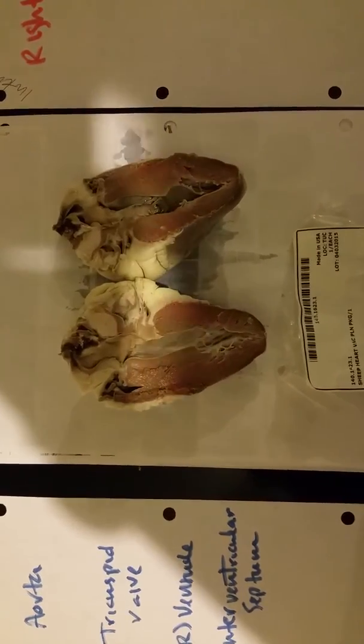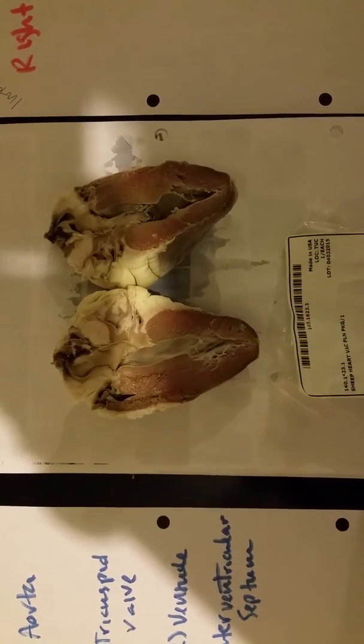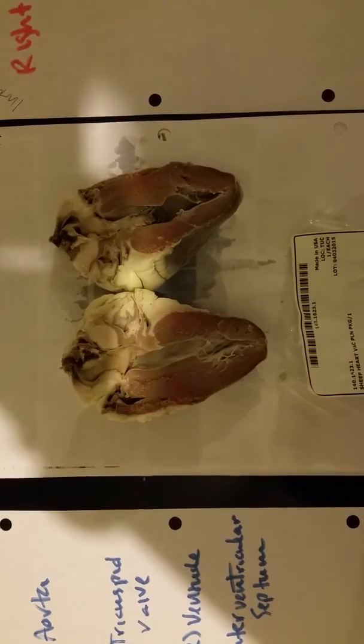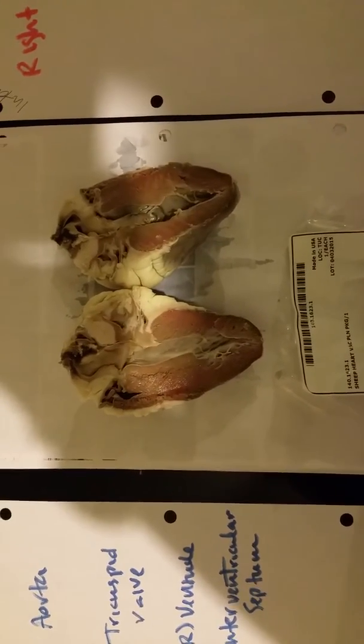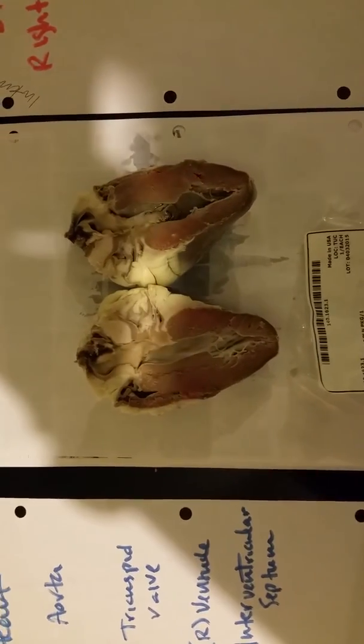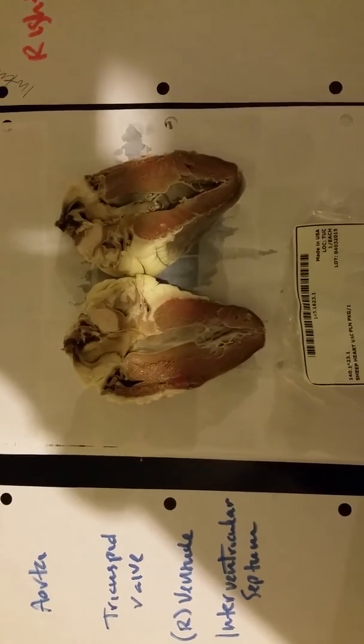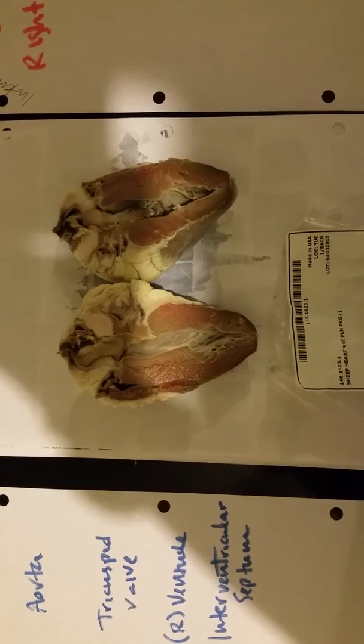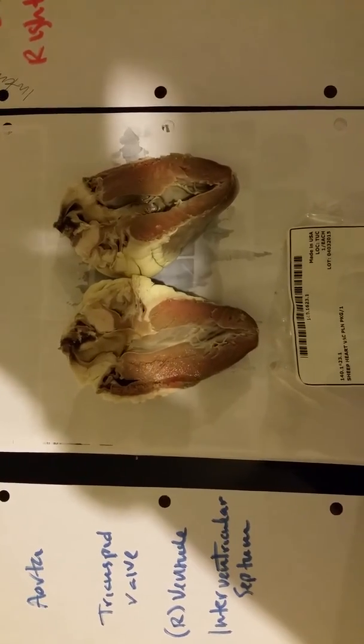So to wrap this video, we want to make sure that number one, we are always safe in disposing of the heart. We're going to go ahead and wrap it back up. We're going to clean the surface, and then also we're going to take off our gloves and wash our hands.